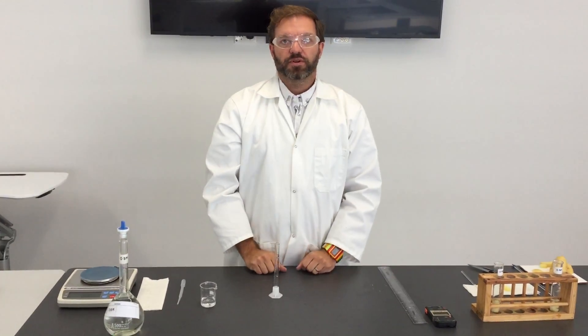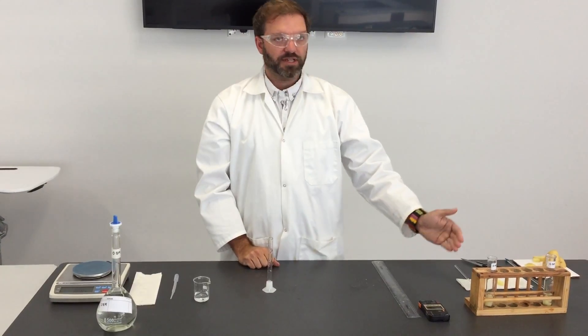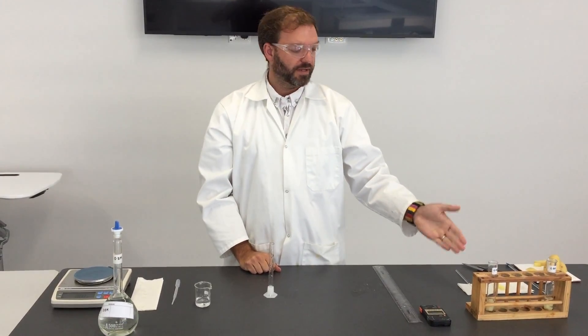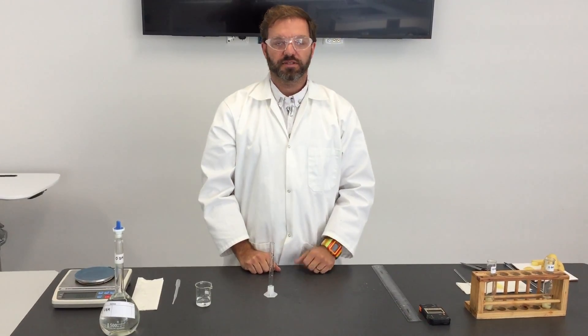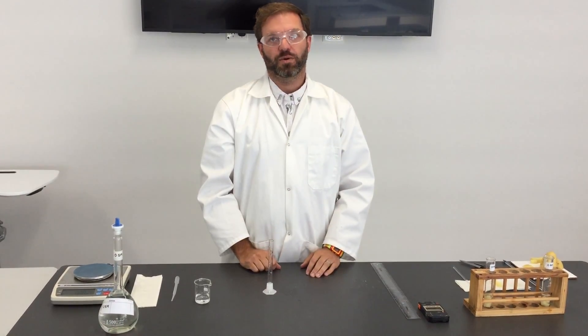So while that's incubating, osmosis will be happening. Depending on the relative concentrations of the solution outside and the solution inside the cells, osmosis—the transfer of water—will happen into or out of those cells.